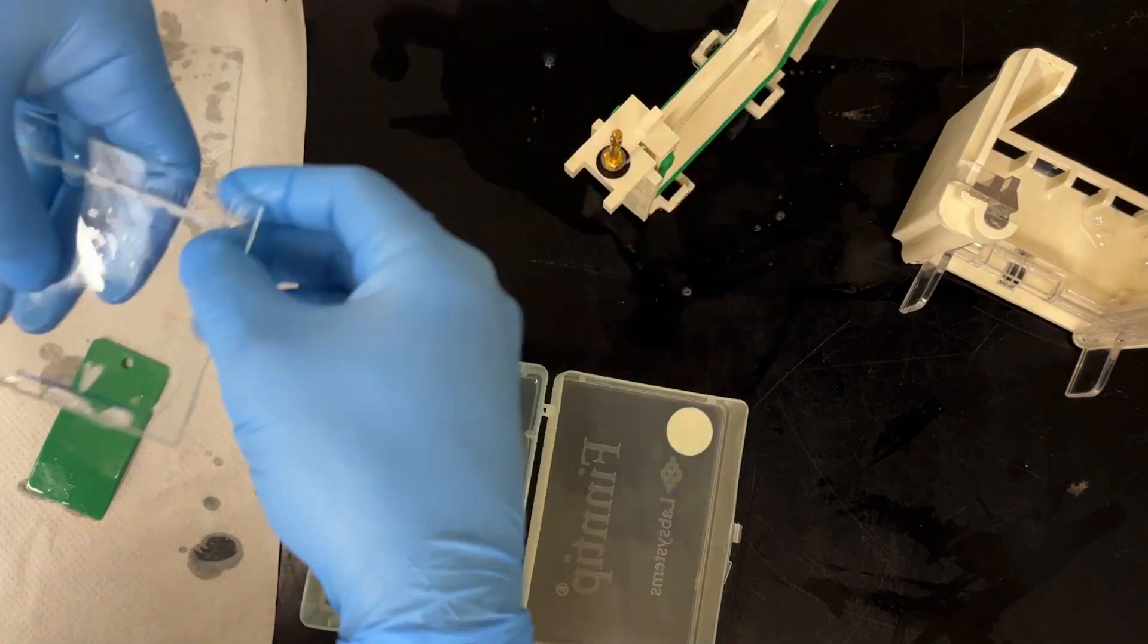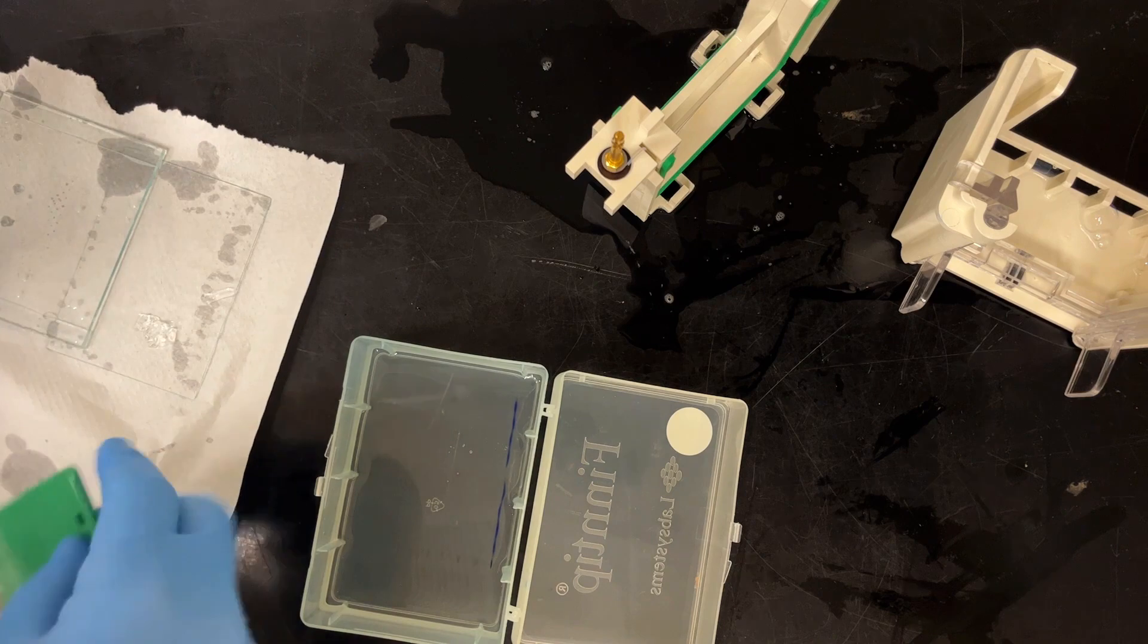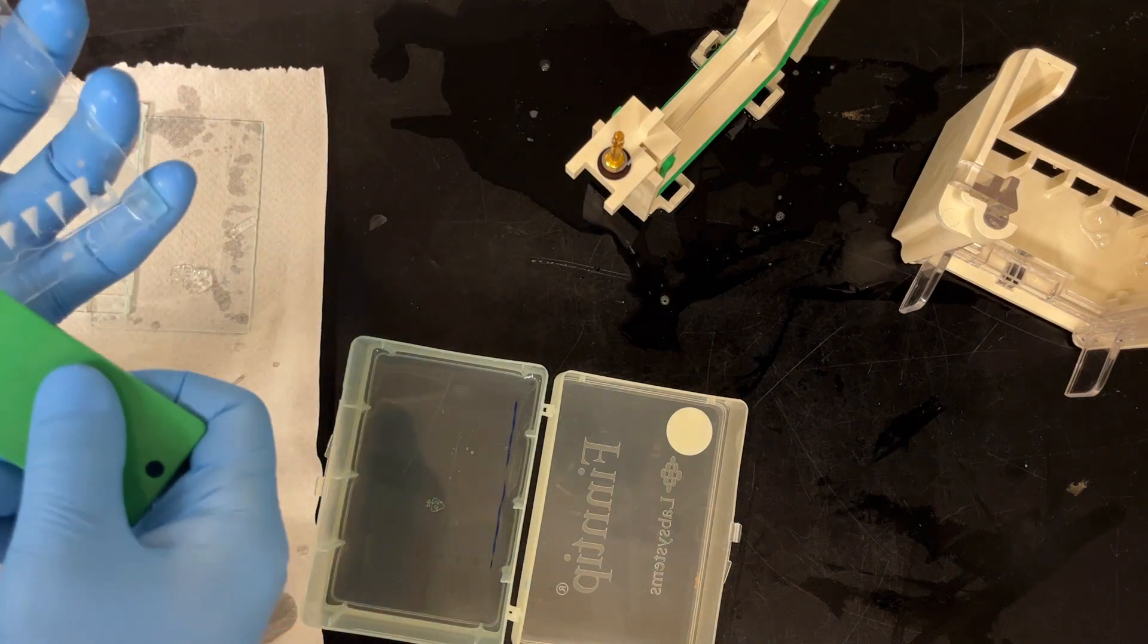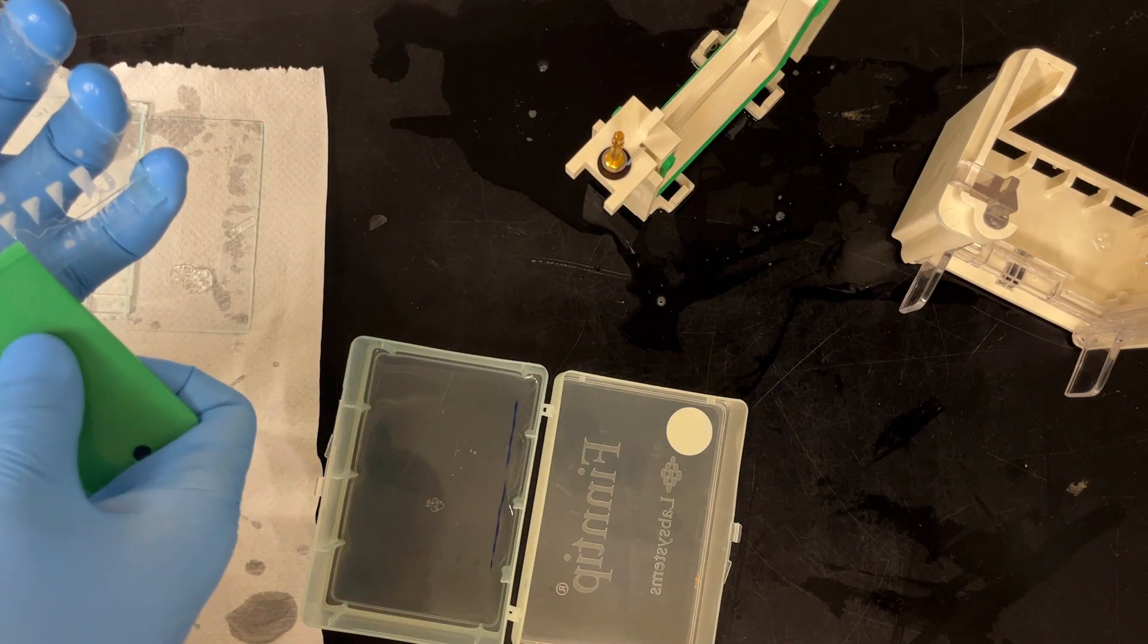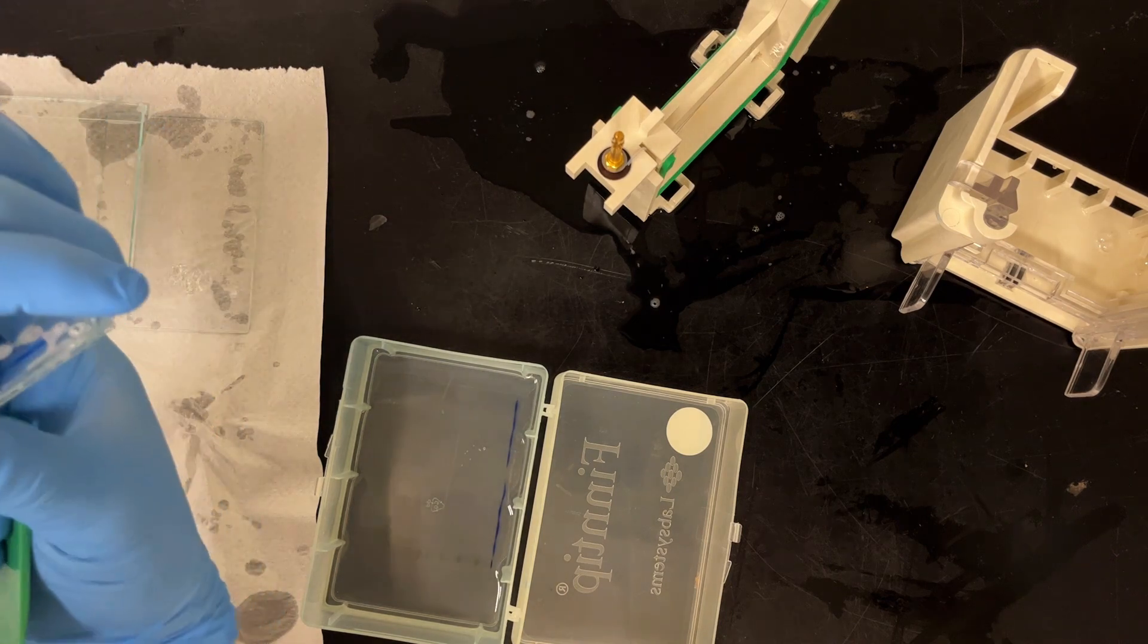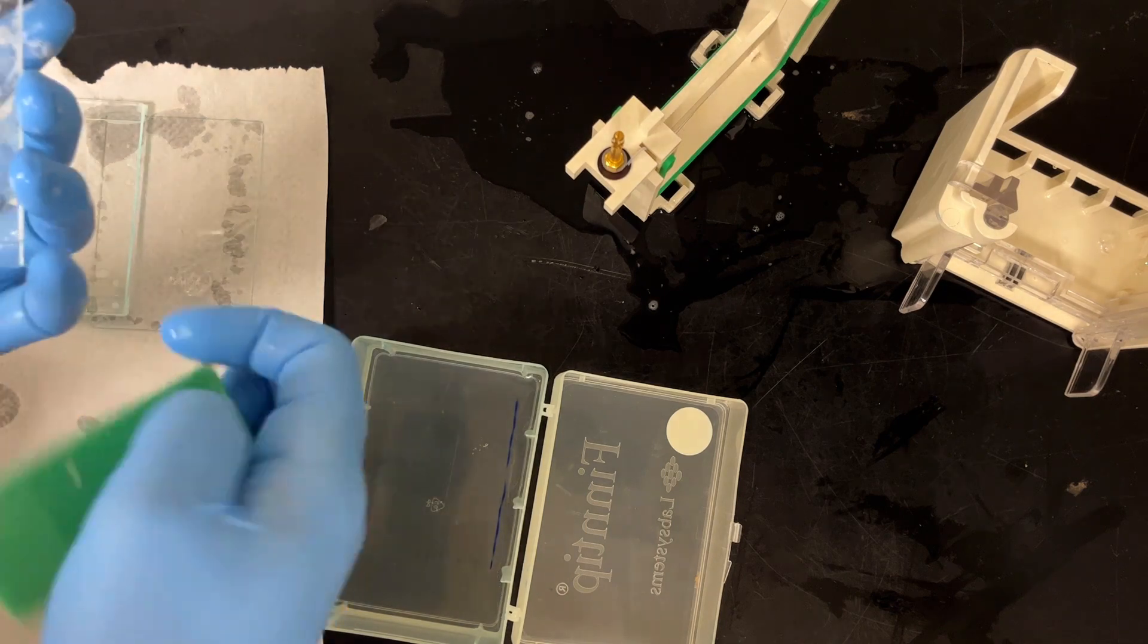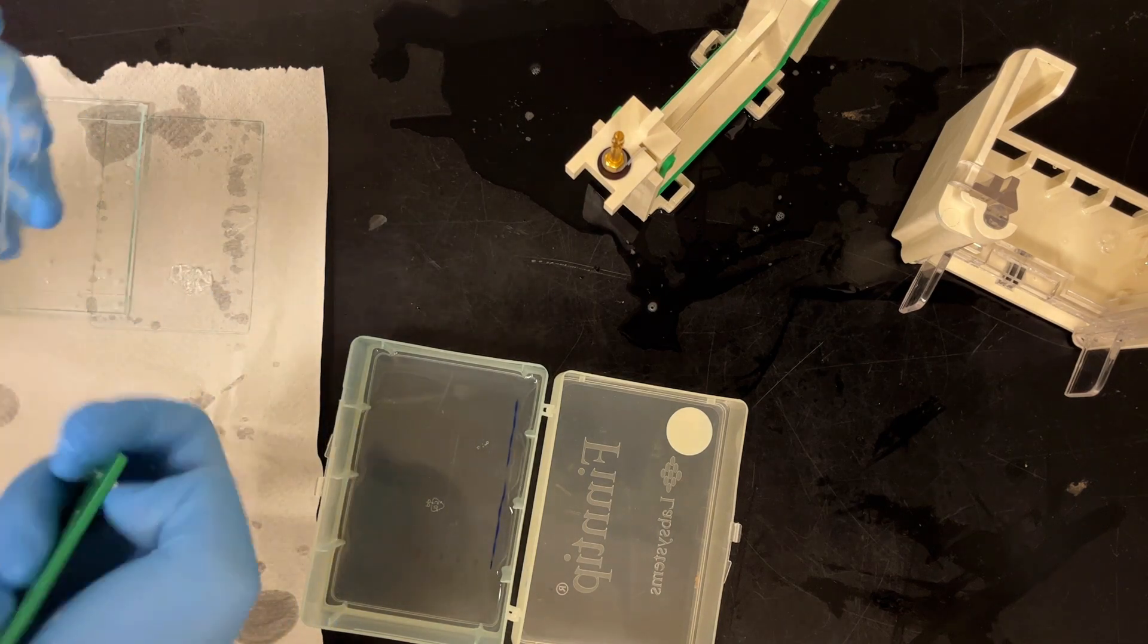And let's repeat that for gel number two. Did I try to make it stick to the other glass plate this time? Sometimes I do, sometimes I don't. I usually just let it stick where it sticks. But you can do it in such a way that you can... I think in this case I tried to get it to stick to the small plate.